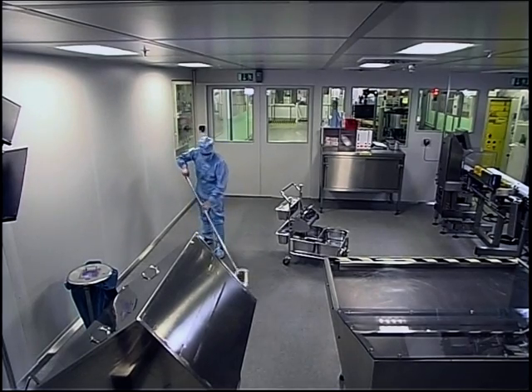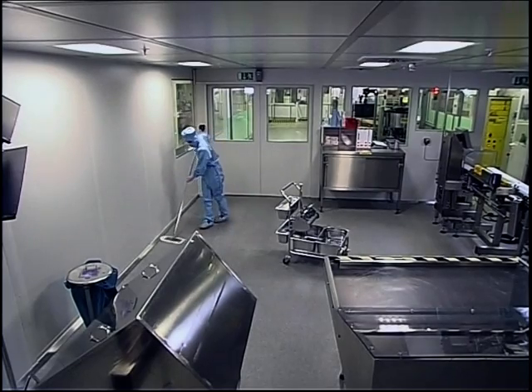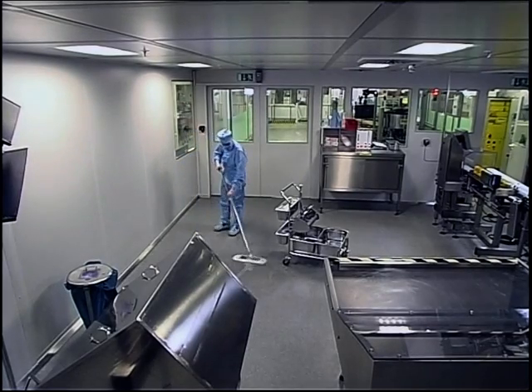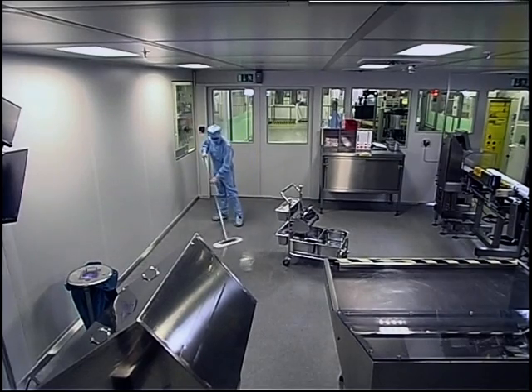In order to clean the floor in the right direction and according to the planned scheme, first push a track along the wall to the furthermost part of the room and start wiping there. Then, while walking backwards, wipe the surface in those figure of 8 movements.